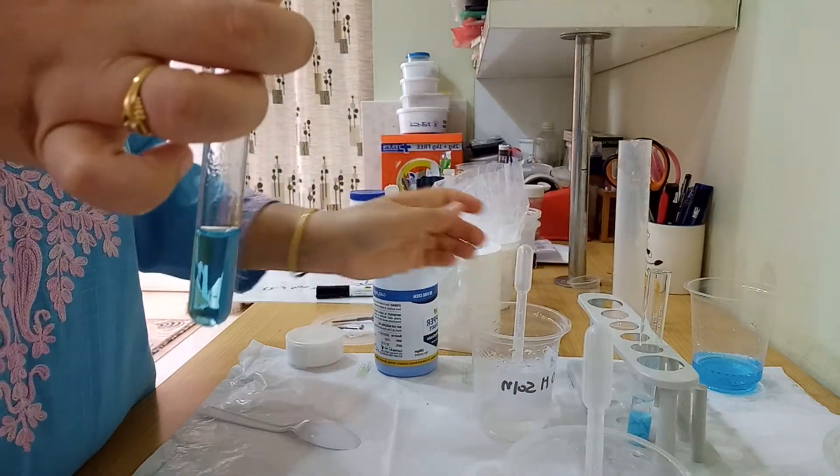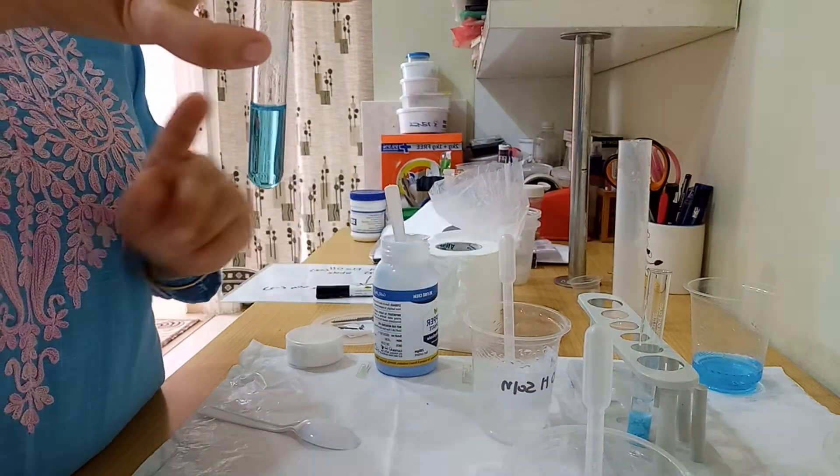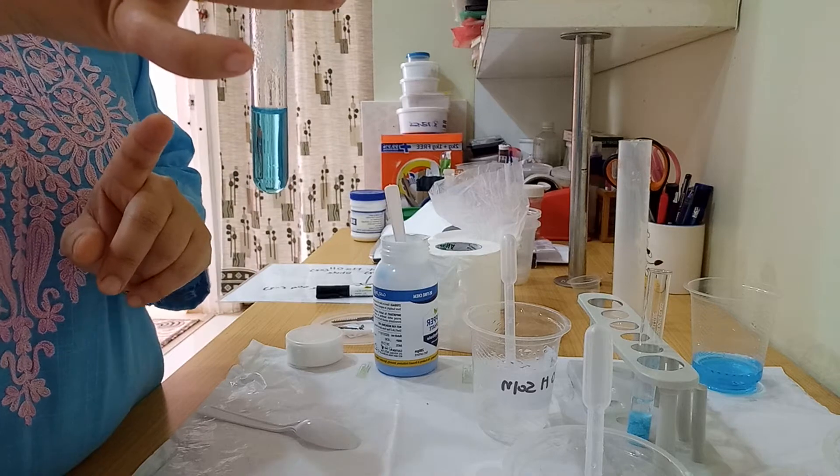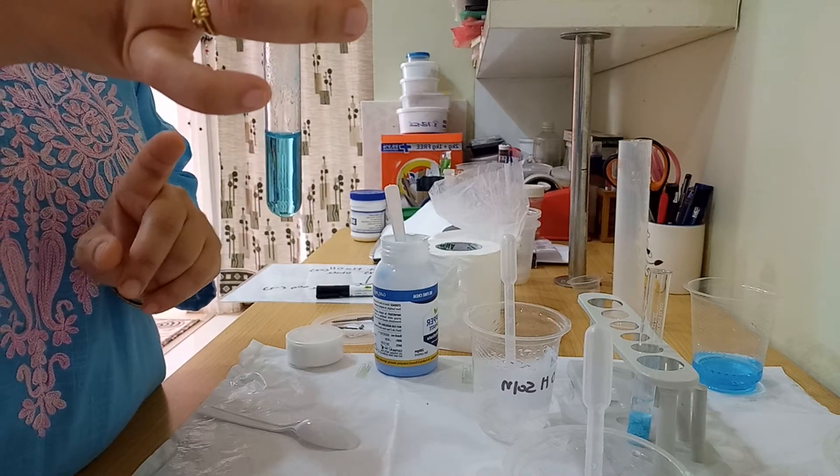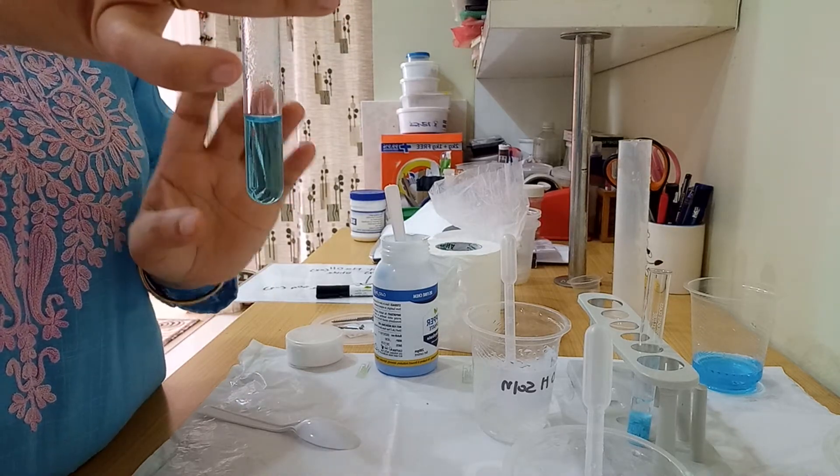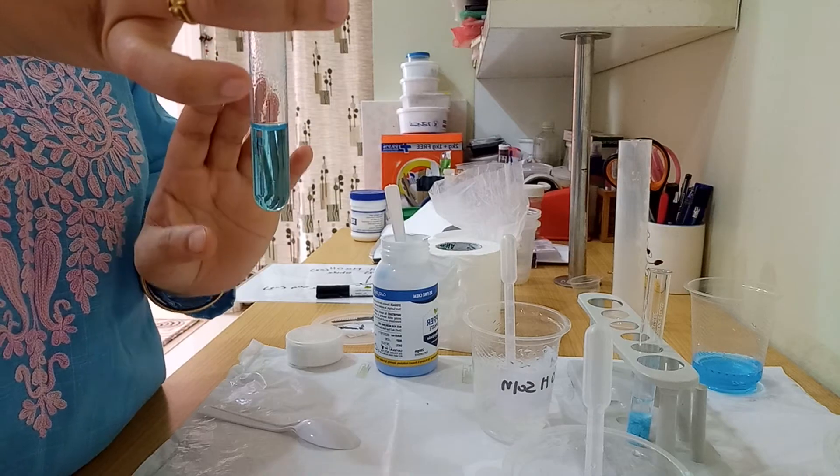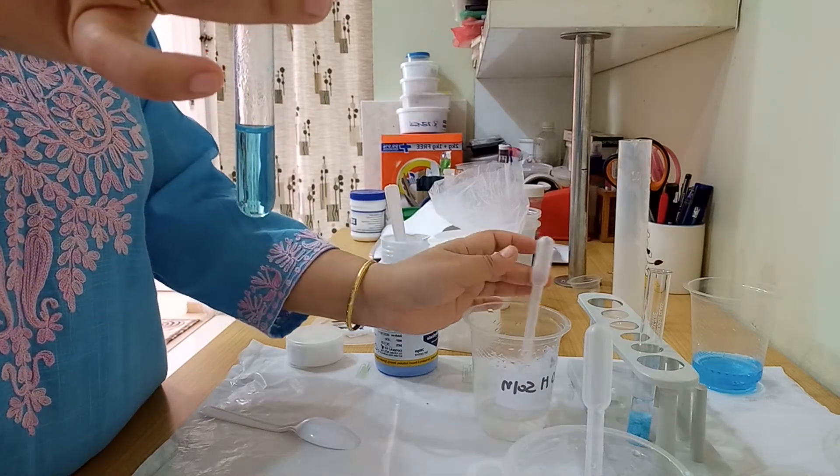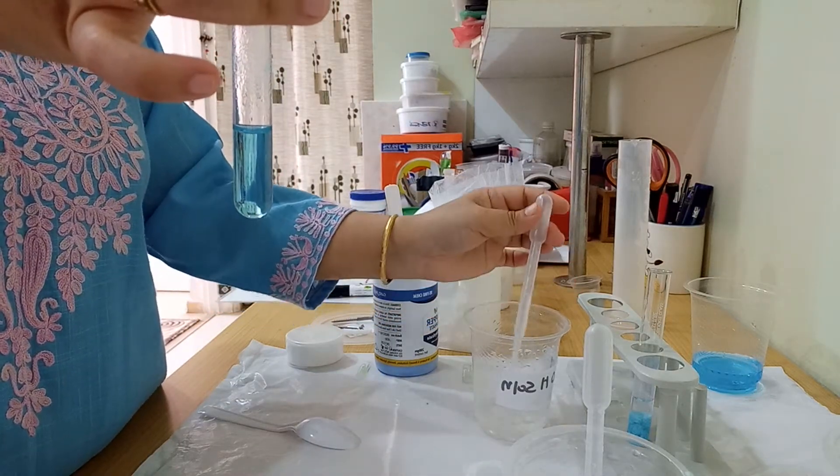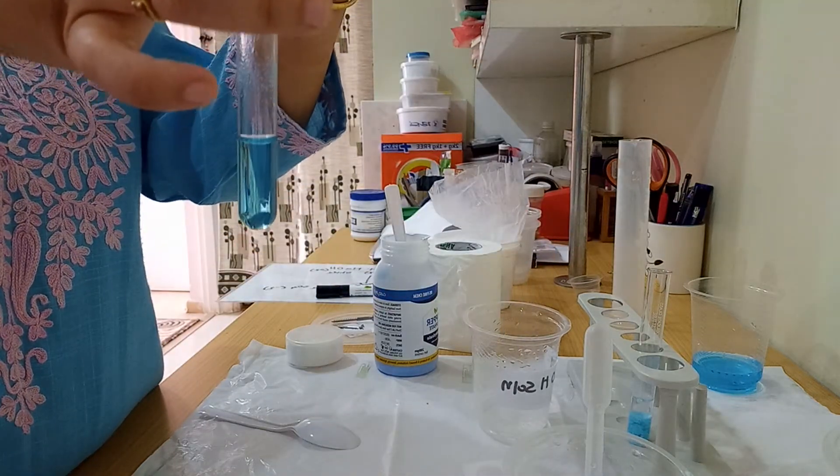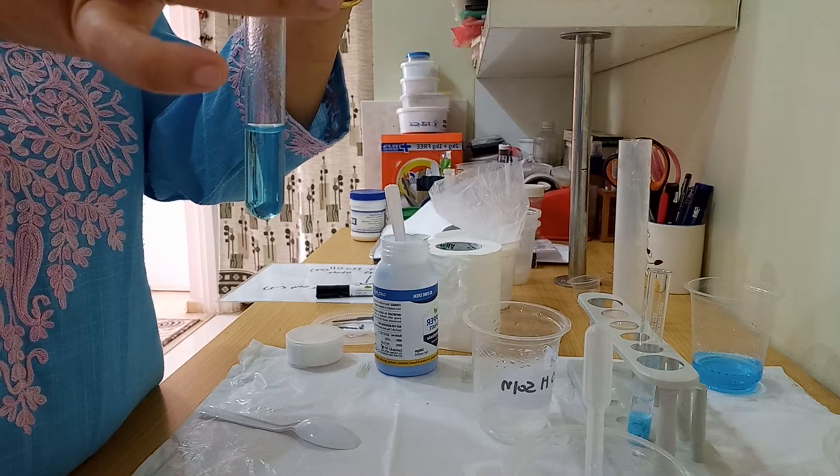Now I'm going to add sodium hydroxide solution here. Observe carefully what is happening. This is a clear, homogeneous solution. I'm going to add sodium hydroxide here dropwise. Observe it carefully.